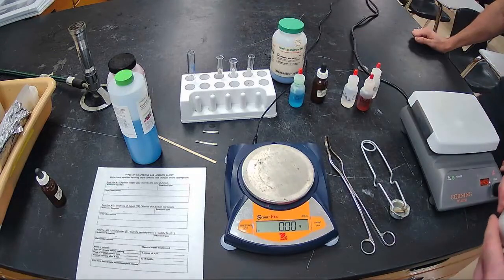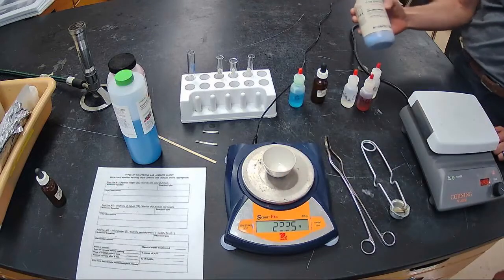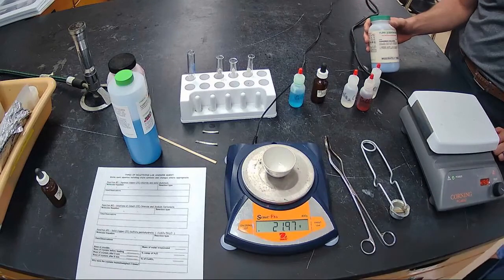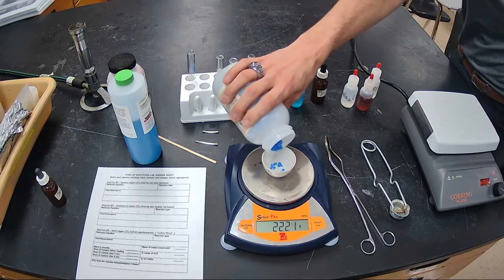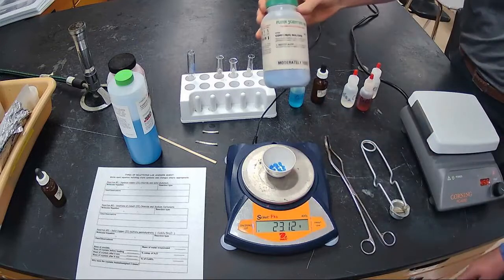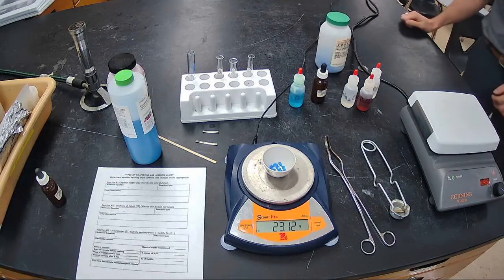We're going to do the reaction number 3 to get this one going, and we'll come back to this because it takes some time. We're going to take the mass of our crucible. Please record on your data sheet 21.97 as the mass of your crucible. We're now going to add some copper 2 sulfate to that, and you'll want to find the mass of the crucible before heating. So we're going to gently cover a little bit on the bottom. That looks pretty good. We have these nice blue crystals you can see in here. So now we went from 21.97 to 23.12 for our overall mass.